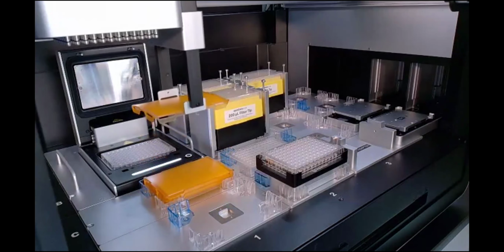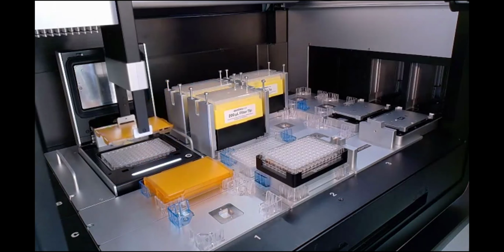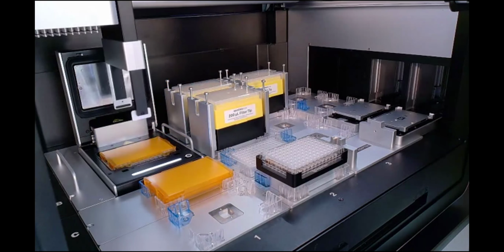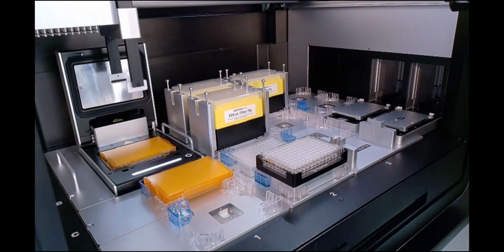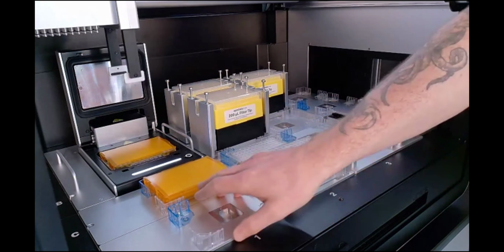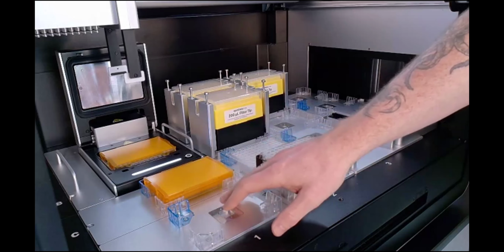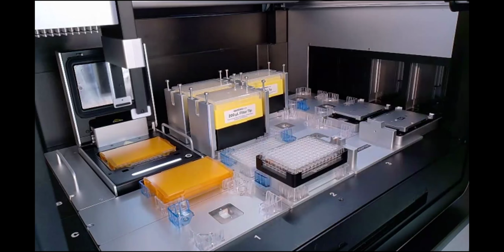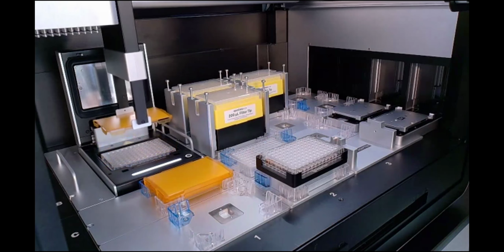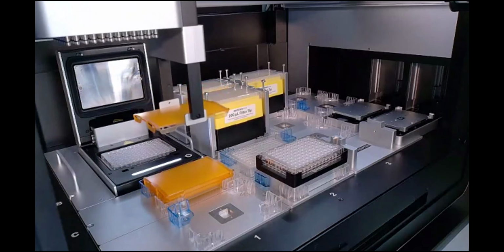Now we're showing off the auto sealing lids here. So we won't be shutting the thermocycler or showing anything like that. You can use your imaginations. It's not the most exciting thing to demo. But here, there's a convex nature, apologies, to these plates, which allows them to pop off of the PCR plate when they are not in this pushed down mode.